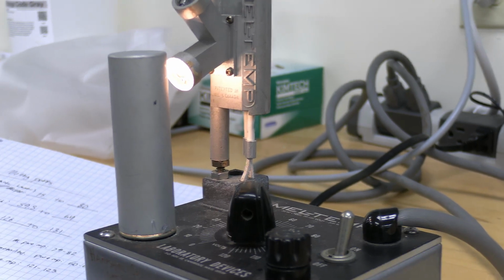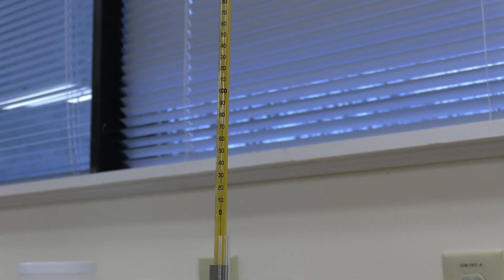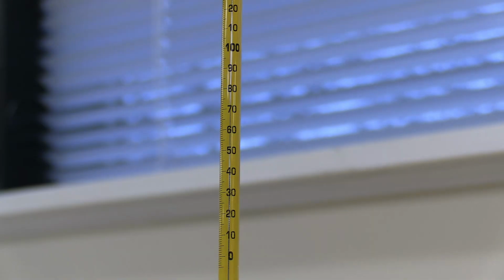The actual crude melting point range will not be exact and will range above or below the pure melting point depending on how impure the product is. Here's a close-up of the thermometer. The black bar inside of it will rise, and you need to watch it closely to see what your melting point range is. It's easier to record the melting point range with a digital apparatus, but this will work fine. Now that everything is set up, all we have to do is wait.